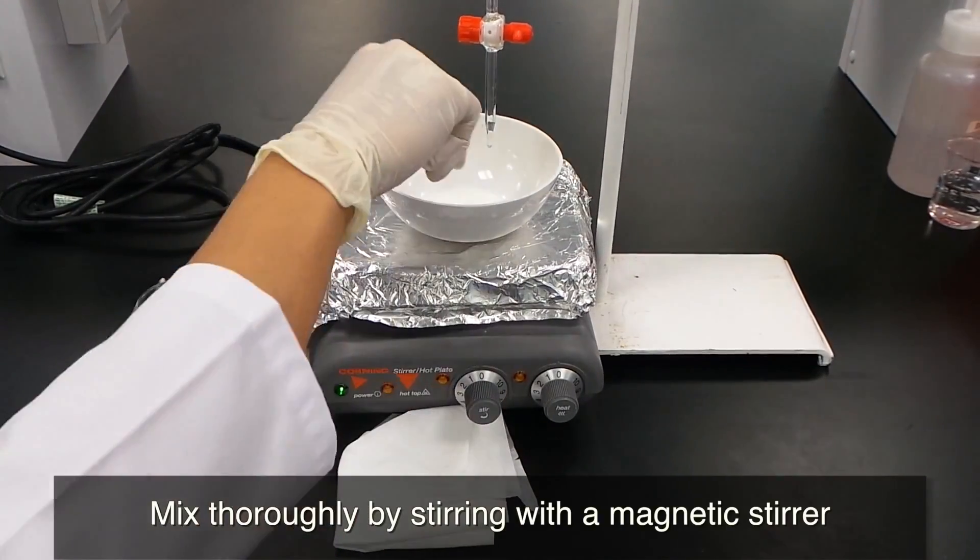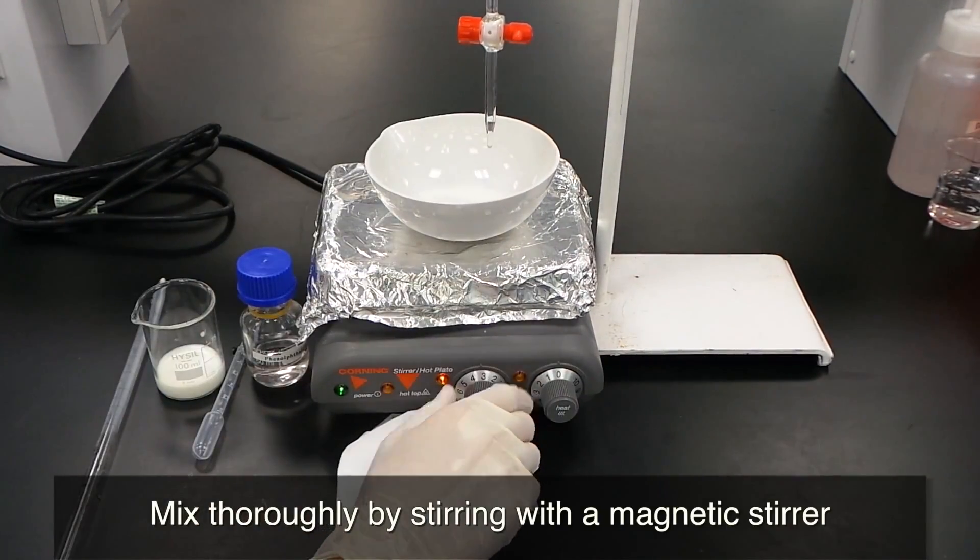Mix thoroughly by stirring with a magnetic stirrer.